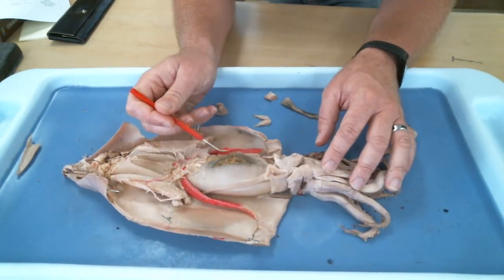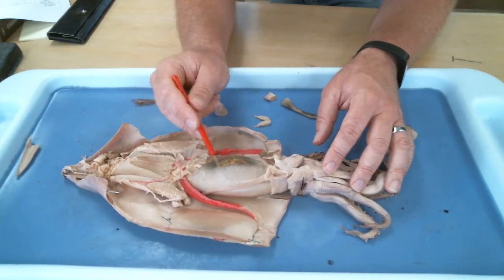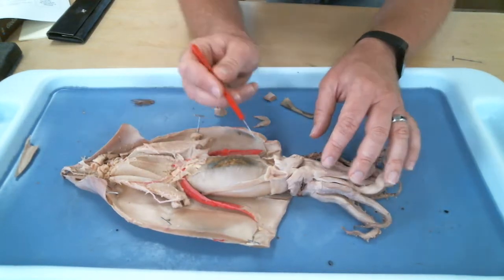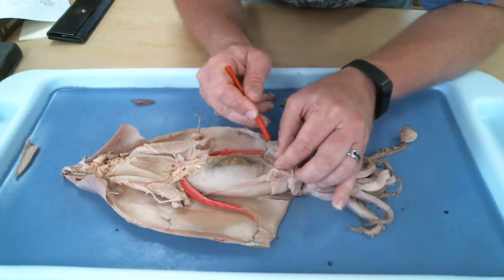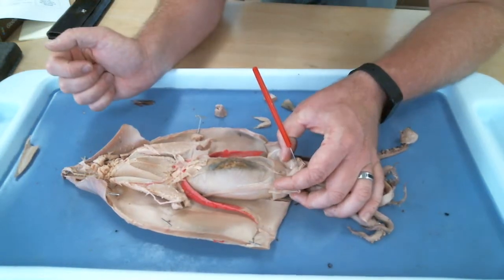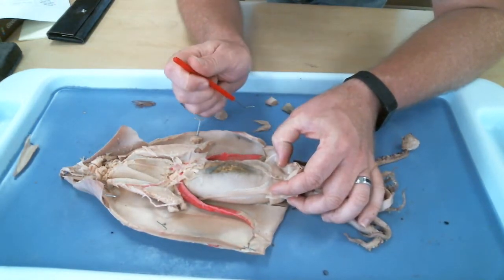This is the stomach. So when this got cut open, this is just what was in its gut when it was killed. So this is the stomach. It's a very large stomach. And then the stomach kind of doubles back on itself, and up at the top, back up in here in the water jet area, is an opening that I am sticking my probe in. What is that opening? That is the anus, yes. He poops out right by the water jet. Kind of a cool design again.